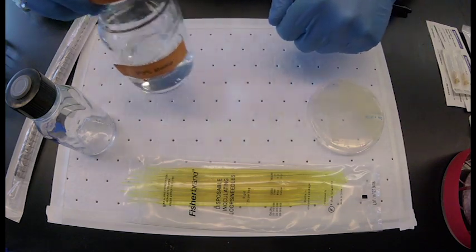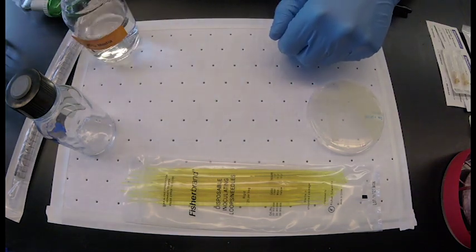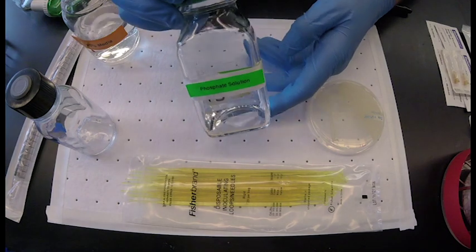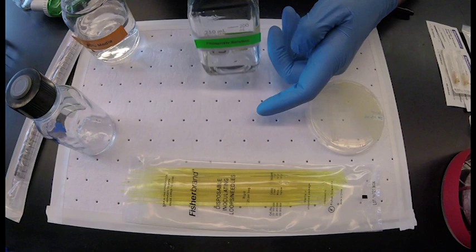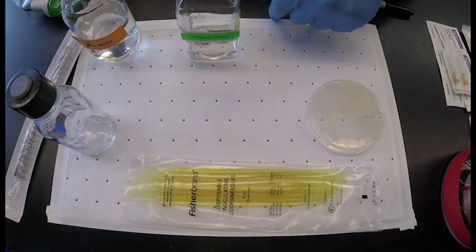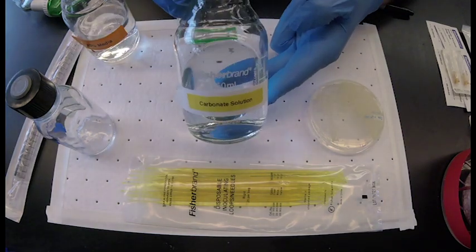a phosphate solution, as well as a carbonate solution. The carbonate helps buffer the media at an alkaline pH for the methanotroph.